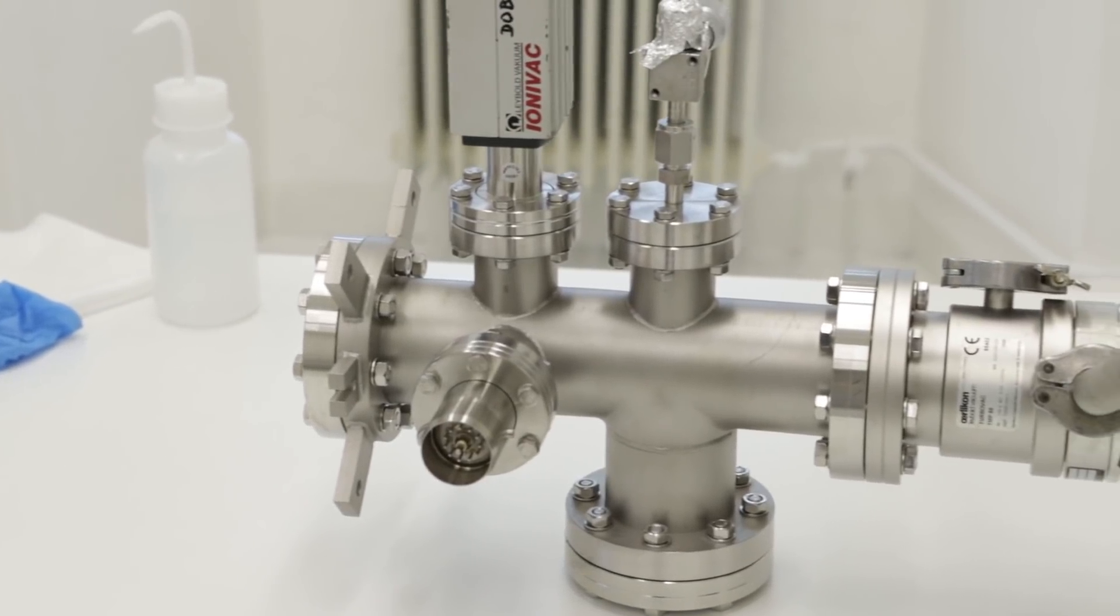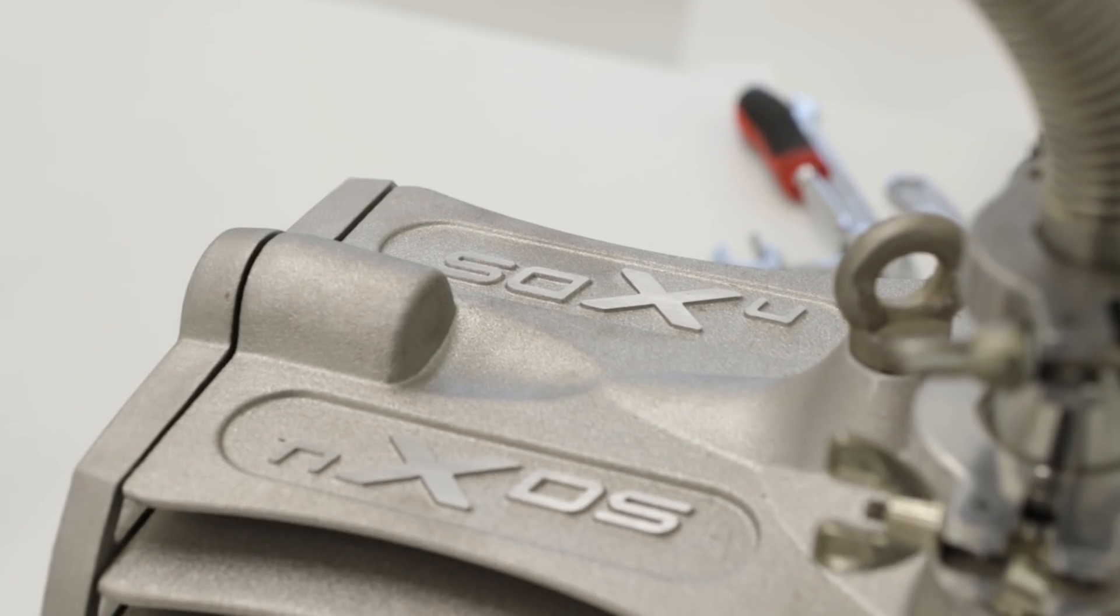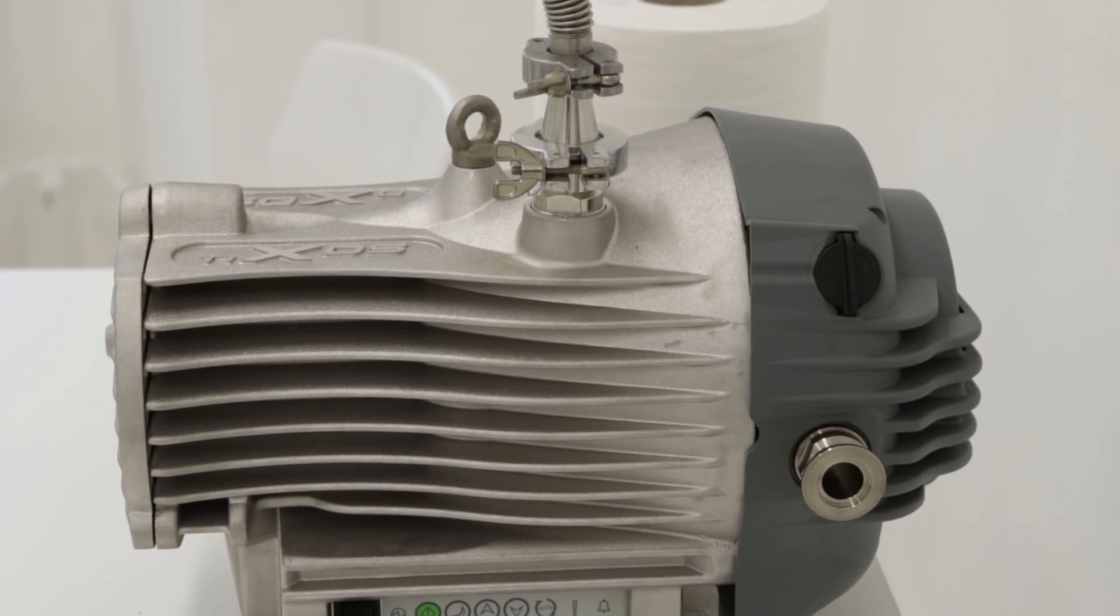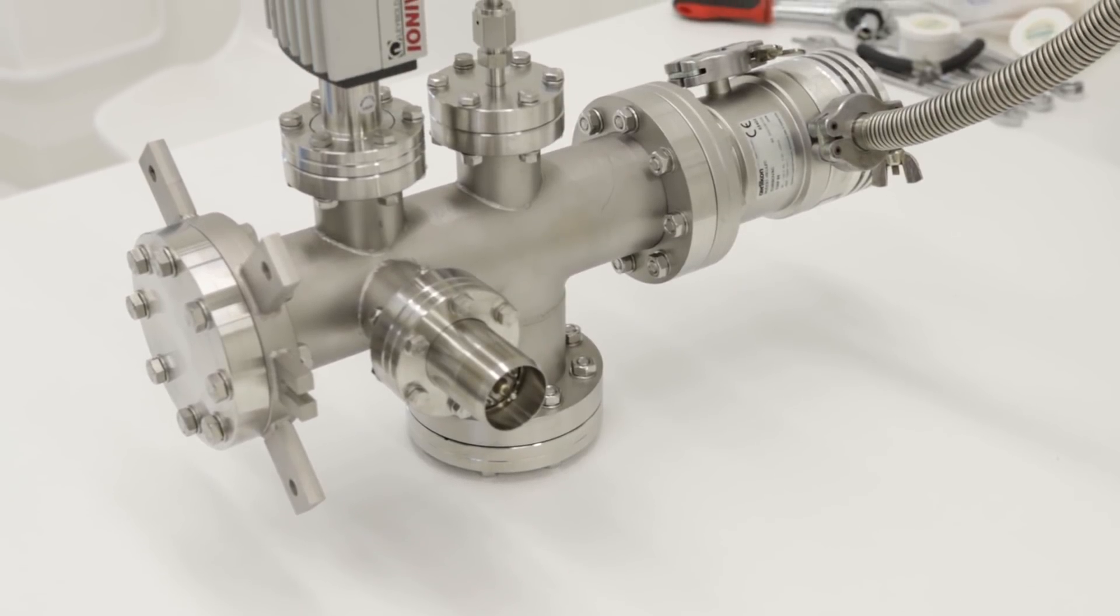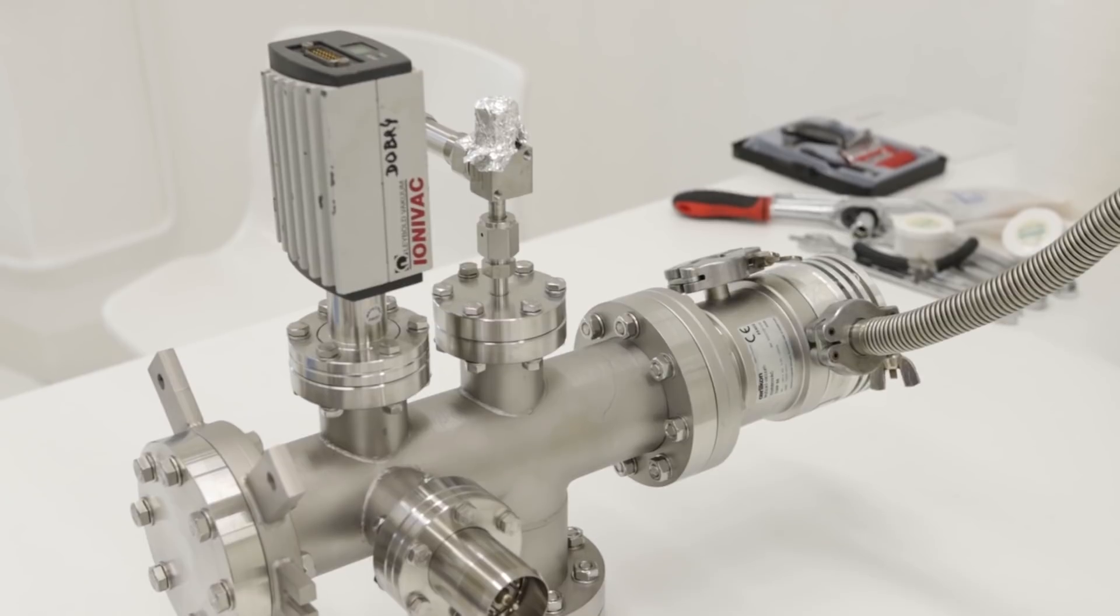One small problem on the project has been fixed, and now we need to test all the other parts like we need to spin the turbo. We need to see if the vacuum sensor is reading the values correctly and the residual gas analyzer. And once all these things are done, we will disassemble the chamber and clean all the mechanical parts and put it all together and try to reach ultra-high vacuum. I've never gotten above ten to minus six millibars - I've never gotten from high vacuum to ultra-high vacuum. So this will be the first time and I'm sure there will be a lot of problems that we'll need to solve. So it will be a very exciting project, and once we have the chamber, we will start solving the problem of how to get the gas from the tube to the chamber without contaminating it with air or with the actual tubing that will bring the gas to the chamber. That's all for today.